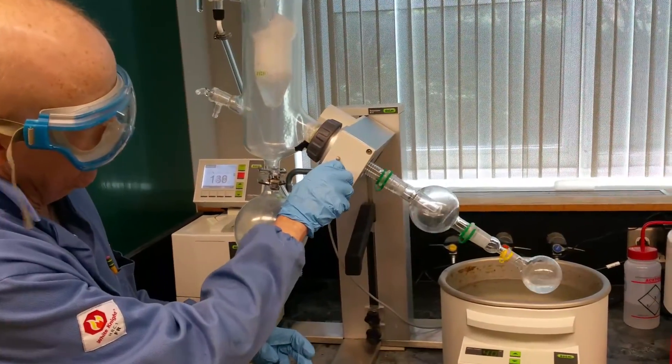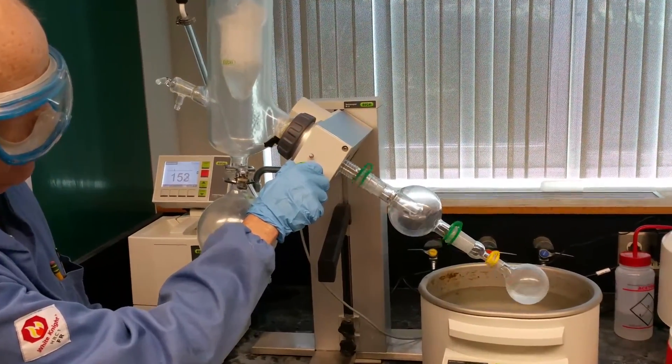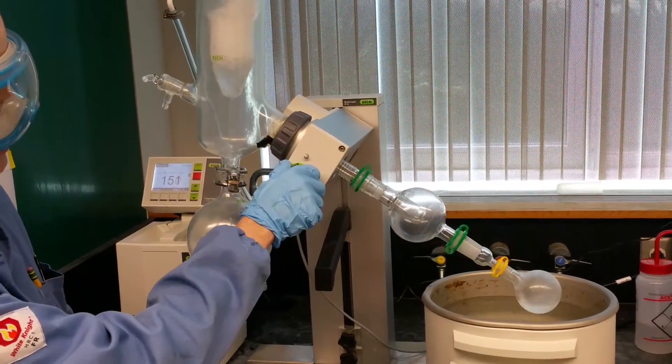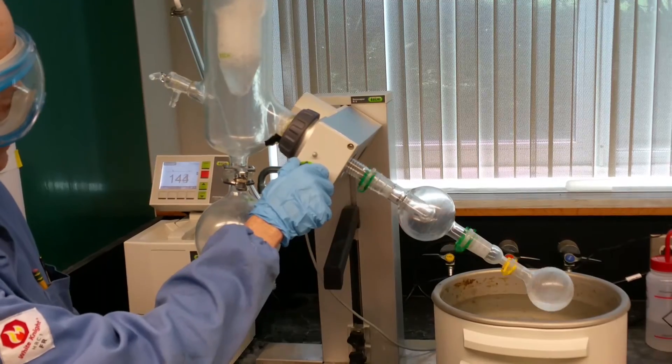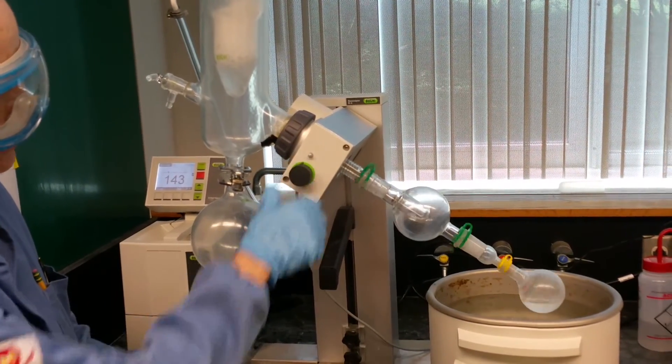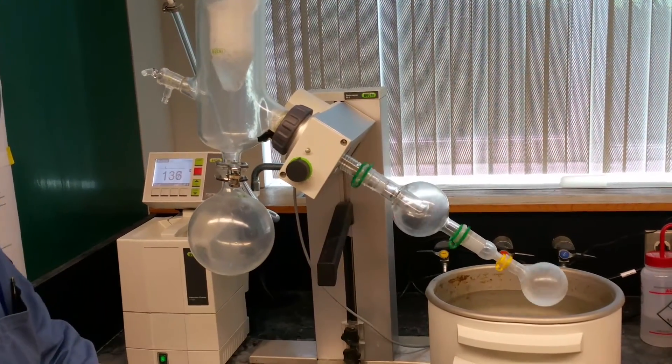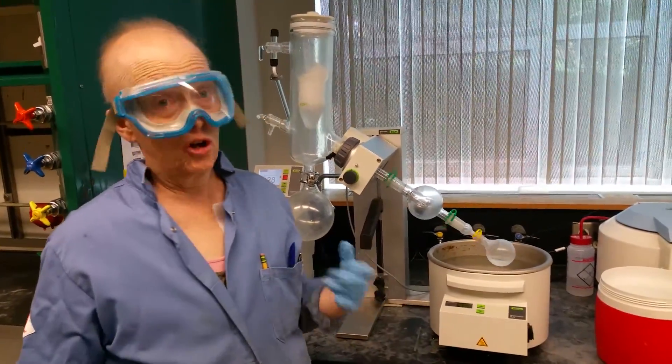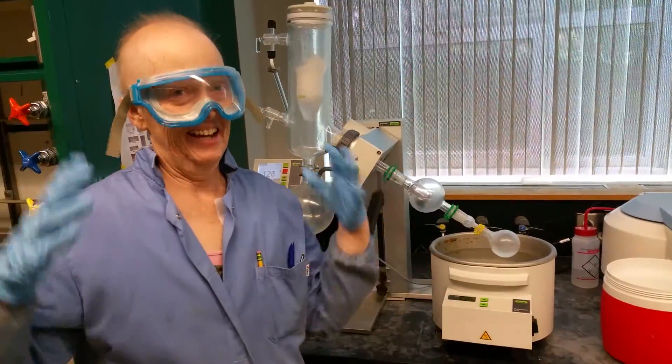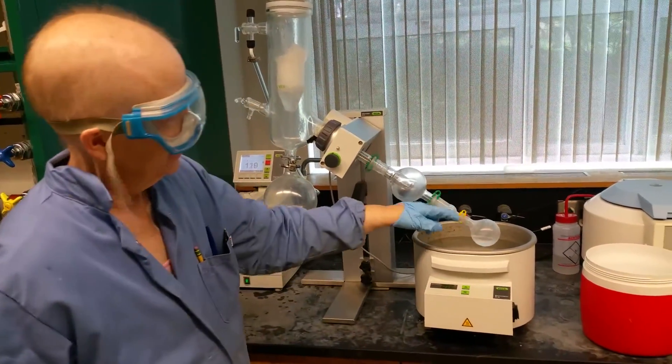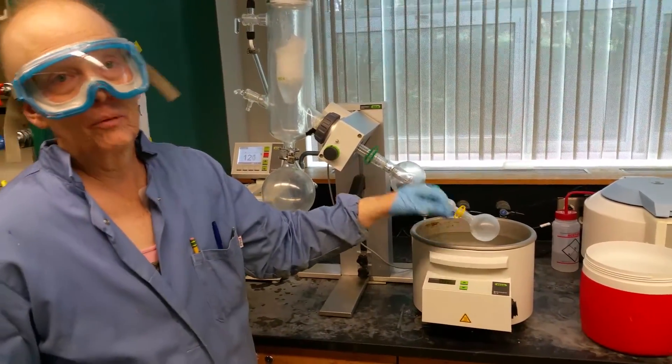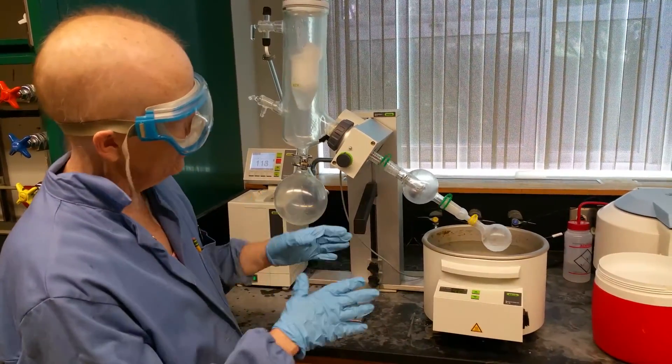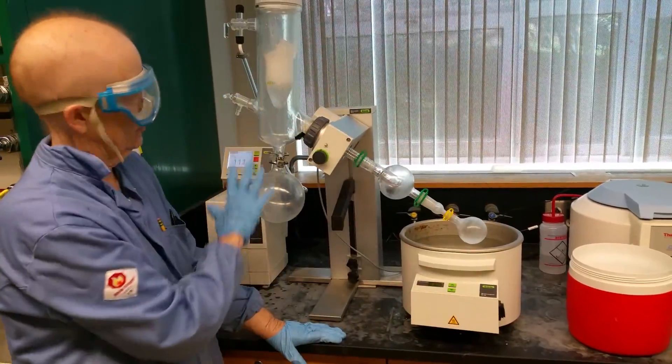What do I want to do? I want to start my sample rotating. So I turn this knob, and you can see it bumped a little bit, which is kind of exciting. So you start this rotating, and it's already distilling. What happened there? Partially because I was talking too long, I let this sit too long before I started rotating.